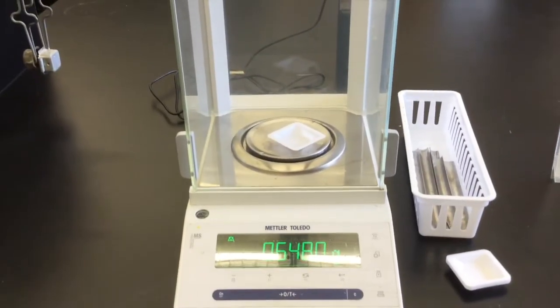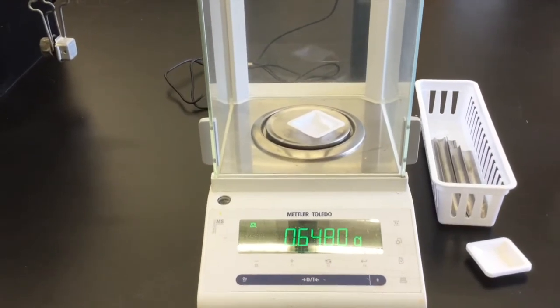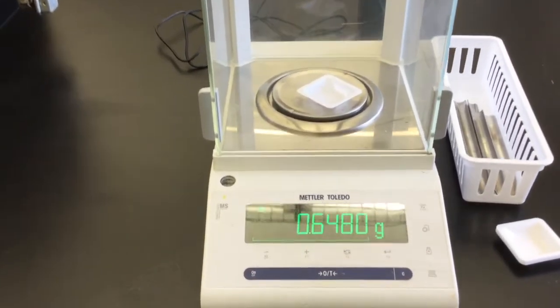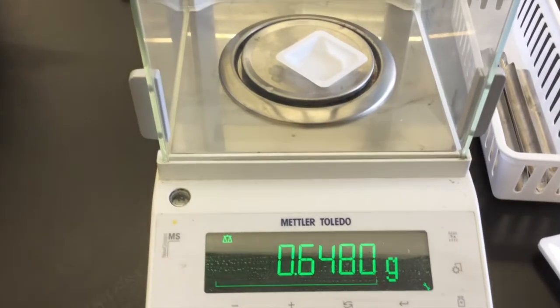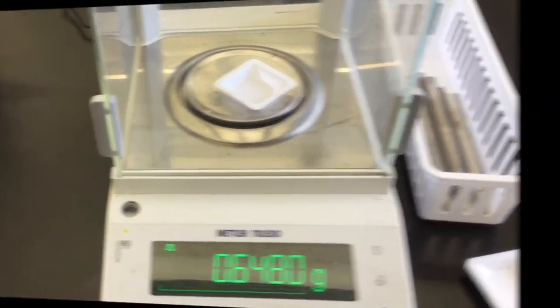You will be using the analytic balance in order to determine your masses here so that we have more precision, more significant figures. Make sure that the doors are closed and then record the mass of the empty weigh boat.